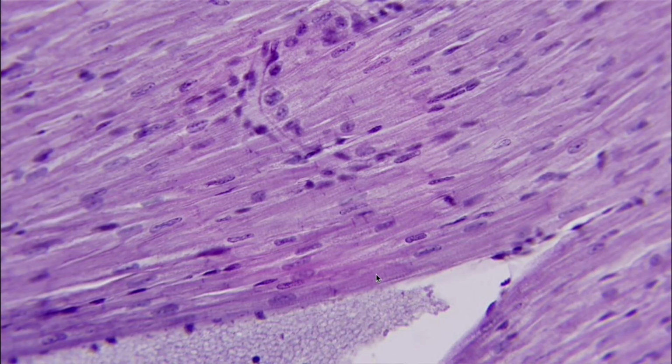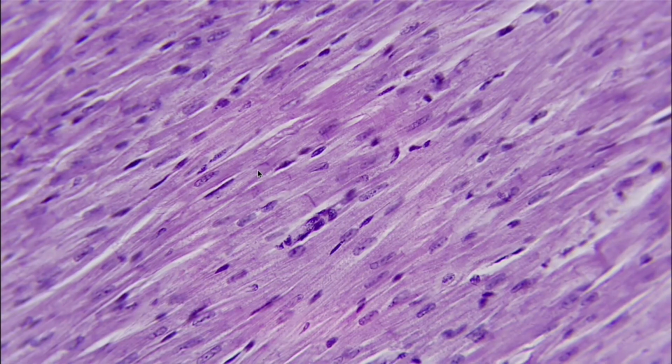We also have these right here. Now, these are going to be called intercalated discs. Right here, and they appear to be really, really dark striations. Here's another example of it. This one I really like a whole lot because you can really tell that is an intercalated disc. There are so many of them. If you try and point them all out, there's just so many, and that's going to be the biggest clue to being able to tell if this is going to be cardiac muscle.